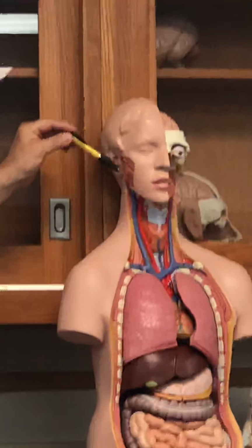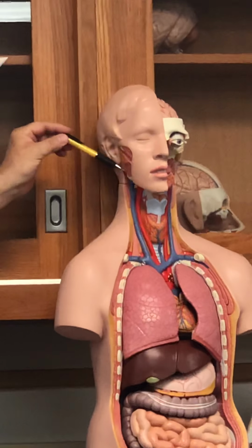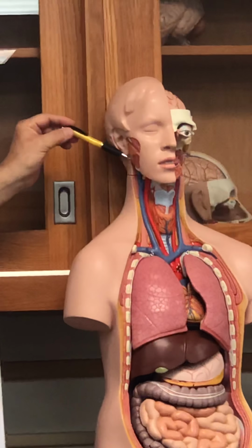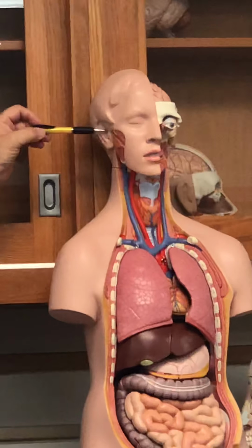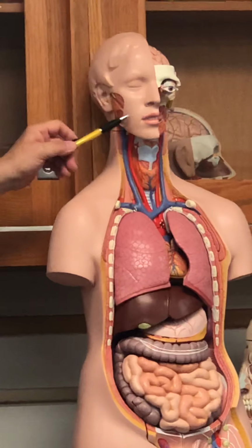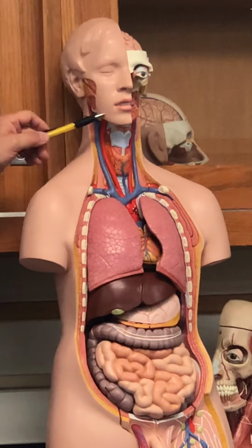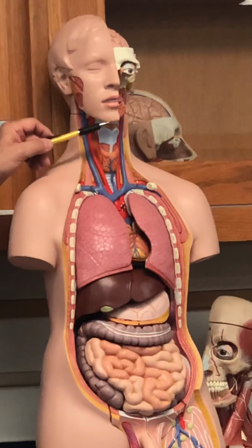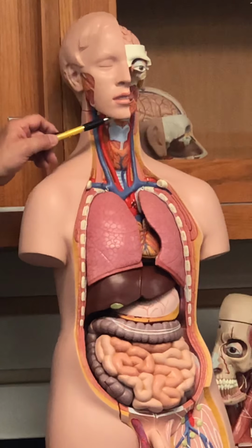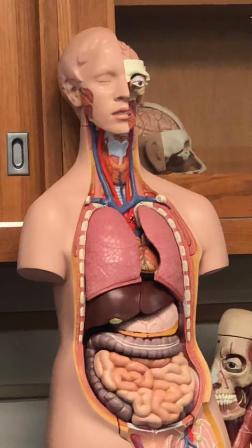All right, how about this gland over on the side there? Parotid. Parotid, this is one of the primary salivary glands. It has a duct here, and it makes its way into the upper area of the teeth, usually around the second or third molar. So the saliva comes in from the top. Then we have two underneath the tongue, submandibular and sublingual. You can't see them very well here, unfortunately.